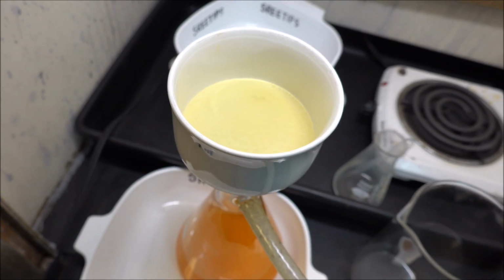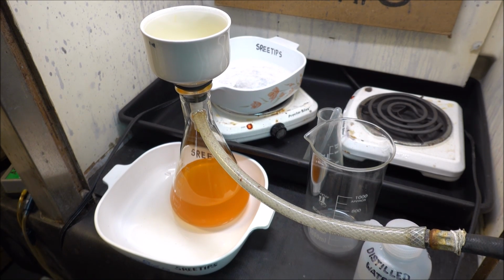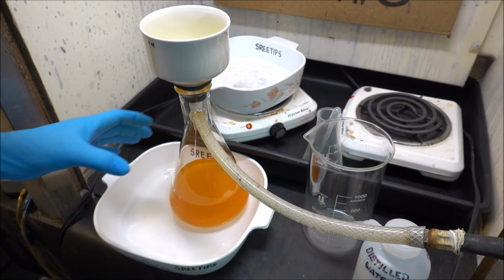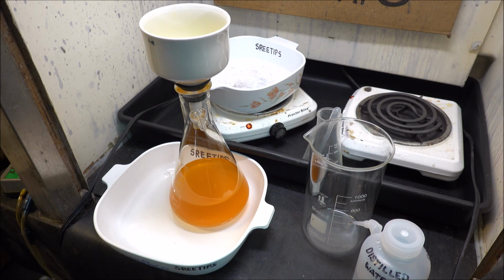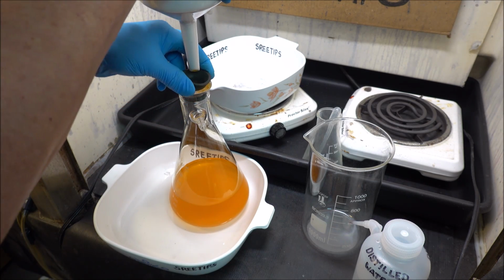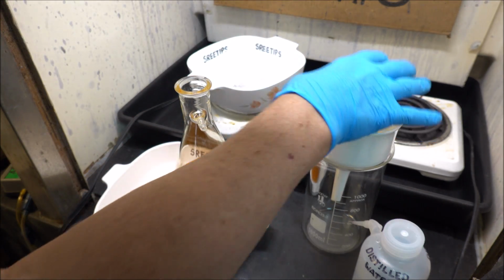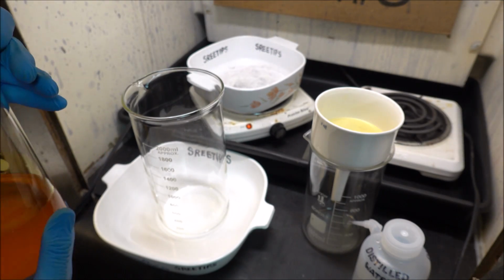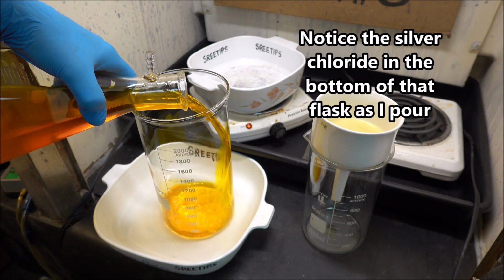It's 6:30 p.m. I've been filtering this solution now for 8.5 hours. I get one drop literally every 5 minutes. It's a matter of diminishing returns now. What I'm going to do is take the filter off of here. It's still got some solution that contains gold, but I'm going to transfer the liquid. We've got most of it down here in our flask. I'm going to transfer the liquid now into this beaker so we can precipitate out the pure gold.